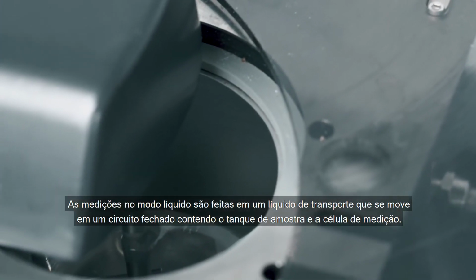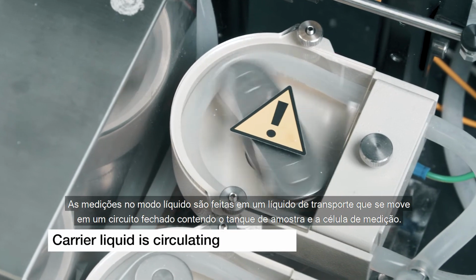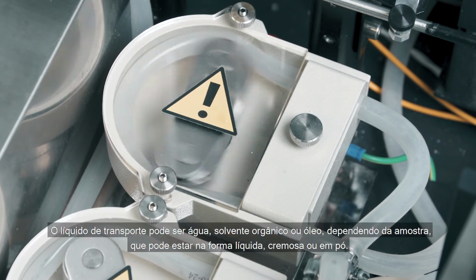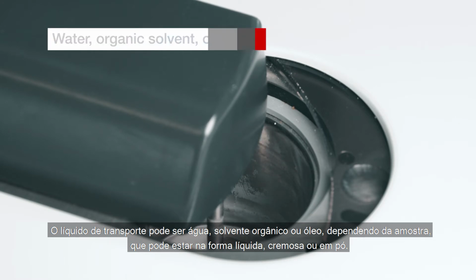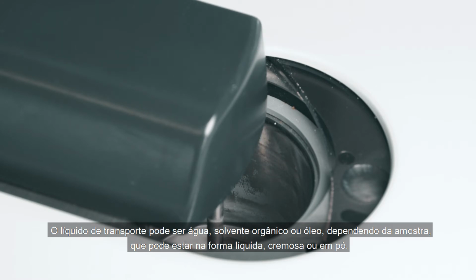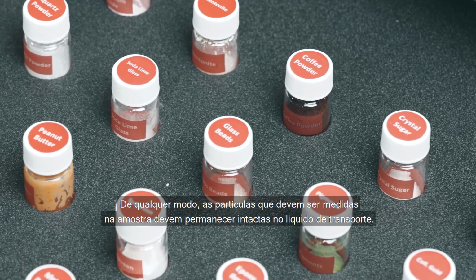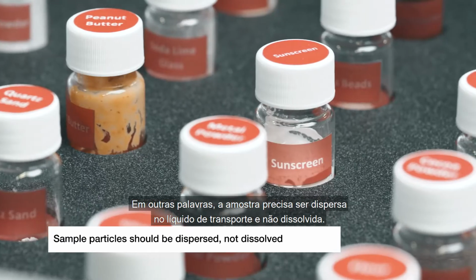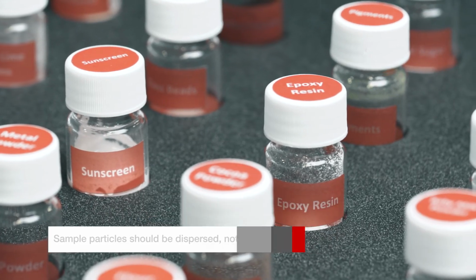Wet measurements are done in a carrier liquid which moves in a closed loop containing the sample tank and the measurement cell. The carrier liquid can be water, organic solvent, or oil, depending on the sample, which can be liquid, creamy, or powdered form. Either way, the particles that are to be measured within the sample must stay intact in the carrier liquid. In other words, the sample needs to be dispersed in the carrier liquid and not dissolved.